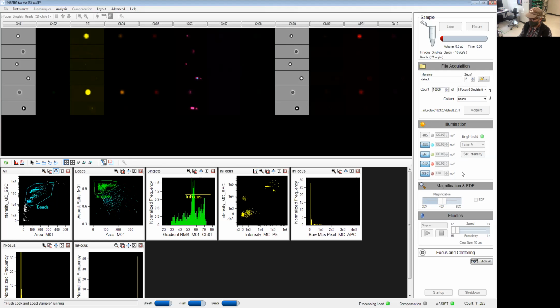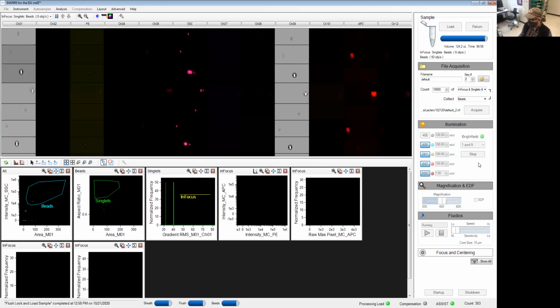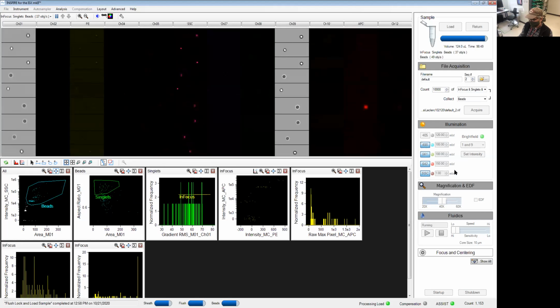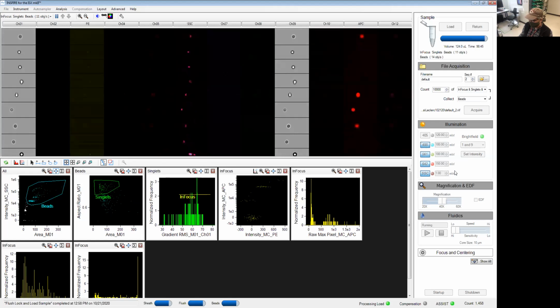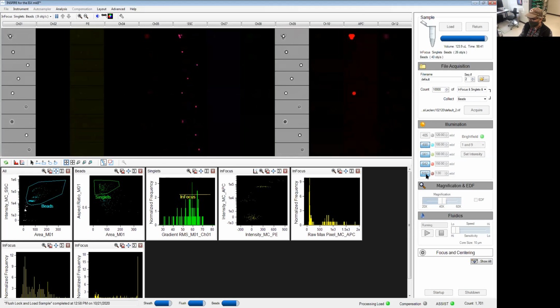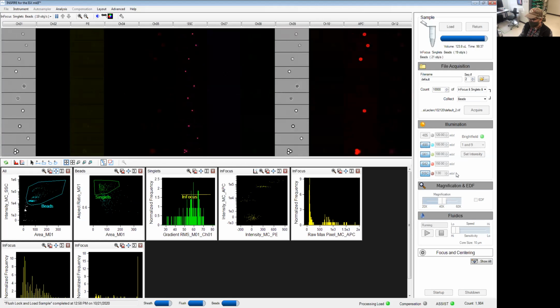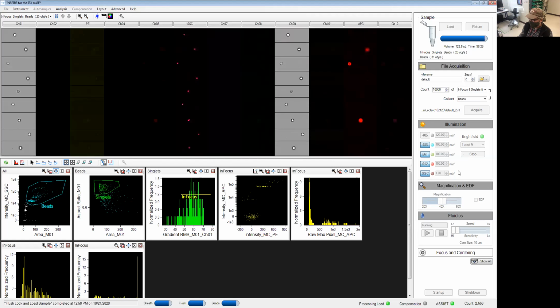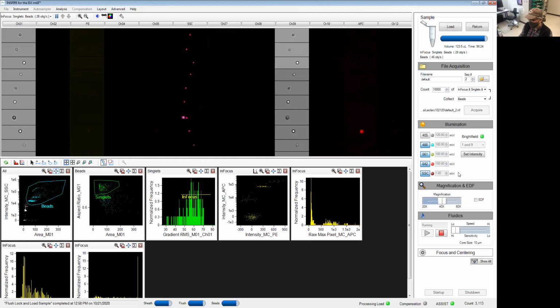Session will start in a few seconds. Eventually, I'll have my controls back. What I'm going to do is... all right, there you go.